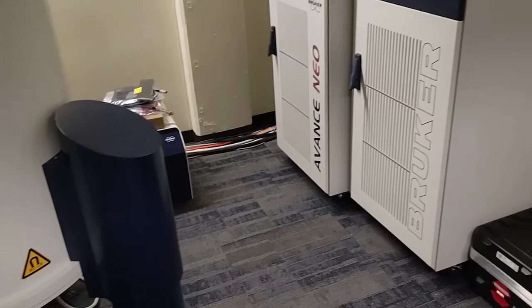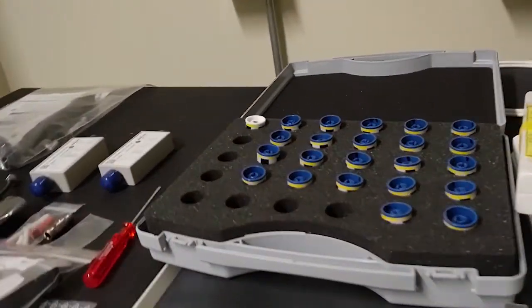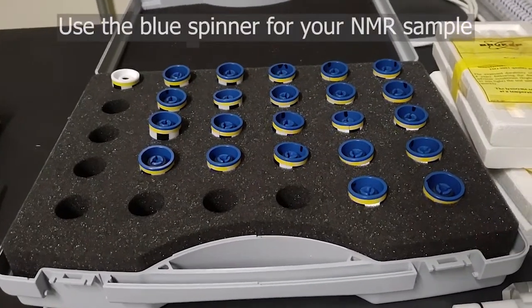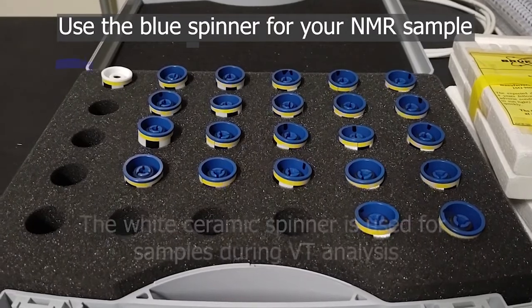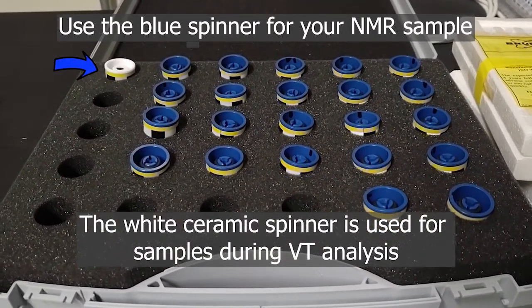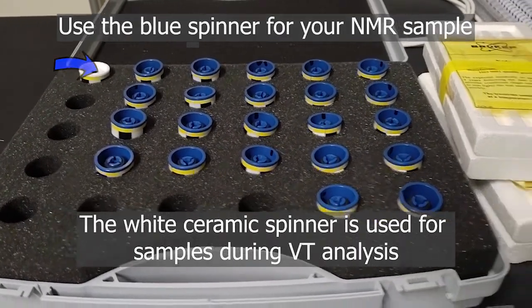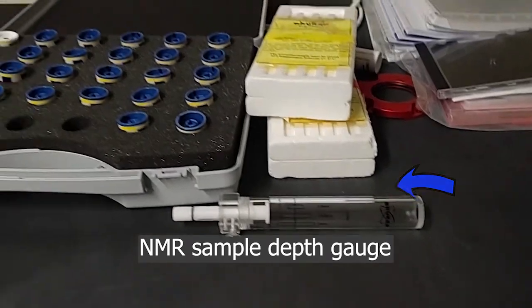To put your sample in a holder, you walk over to the console and you can pick up one of the spinners here. The blue spinners are used for most routine use. The white spinner in the top left is a ceramic spinner, and it's only used for variable temperature NMR spectroscopy. As you can see here, this is the depth gauge, and I'll show you how to use it in a second.